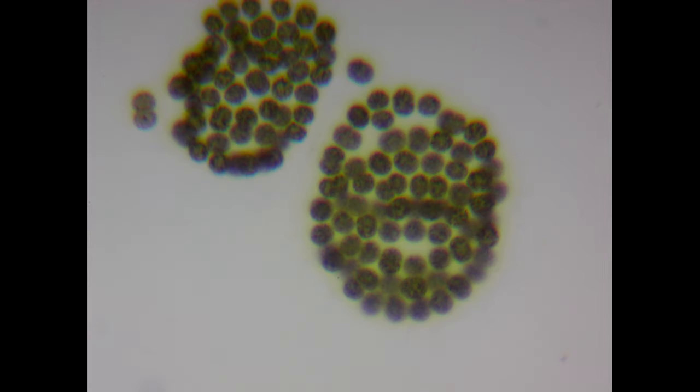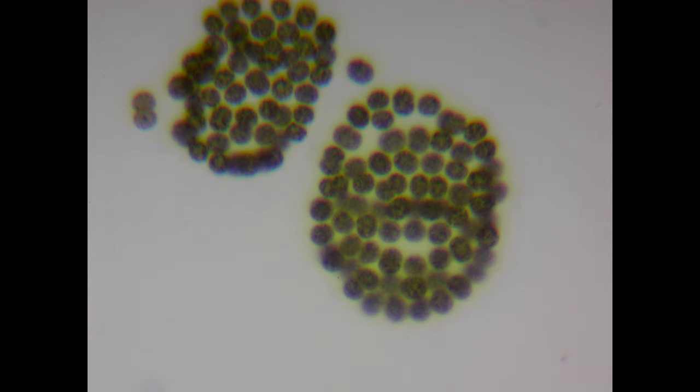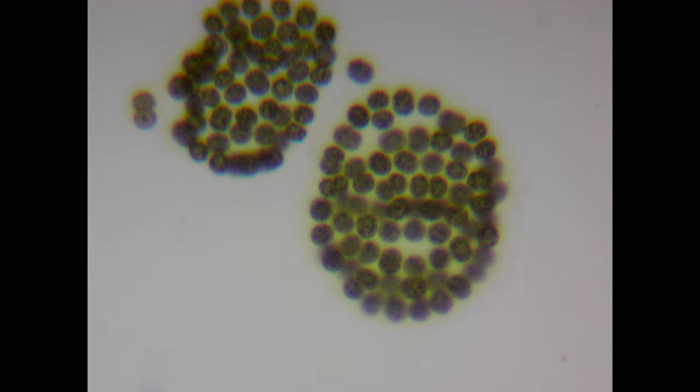I managed to find a really nice example of what I believe to be an algal cluster. These clusters were really green and very well organized and put together, which leads me to think it's an algae of some sort.